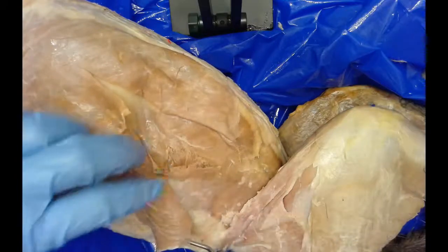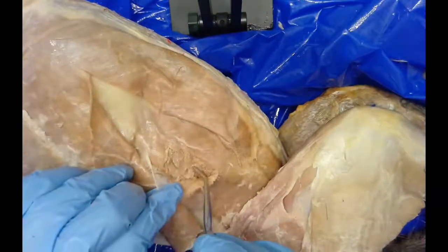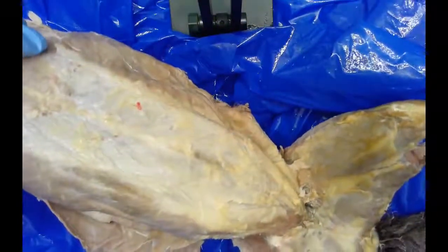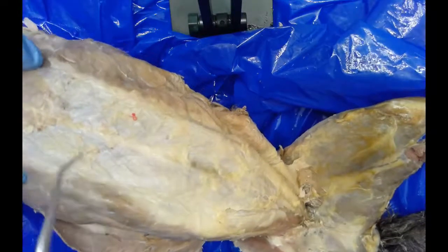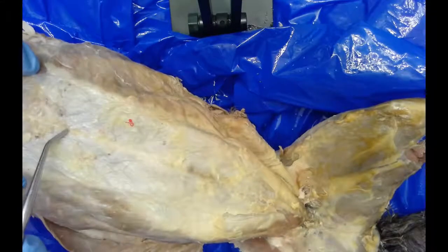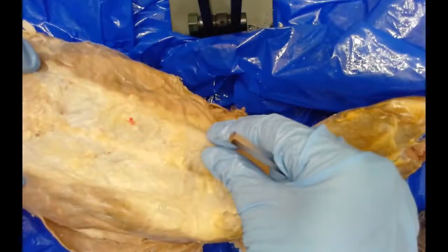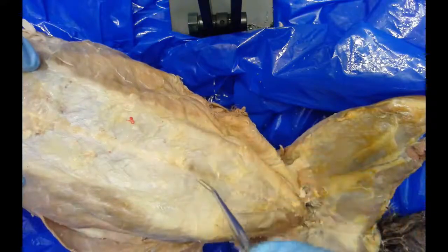So there are three layers here: external oblique, internal oblique, and transversus abdominis. Continuing to look at the abdominal area, I can see strips of muscles found on either side of what we call the linea alba — this faint white line running down the midline, which we also saw in the shark. On either side of that, I see a strip of muscle — those make up the rectus abdominis muscles on either side.